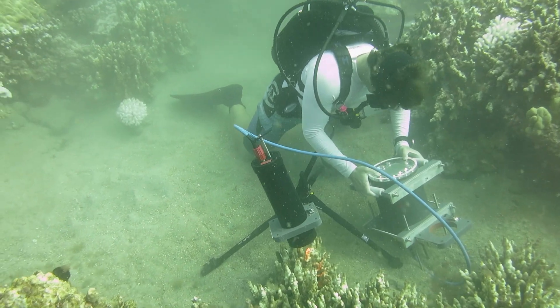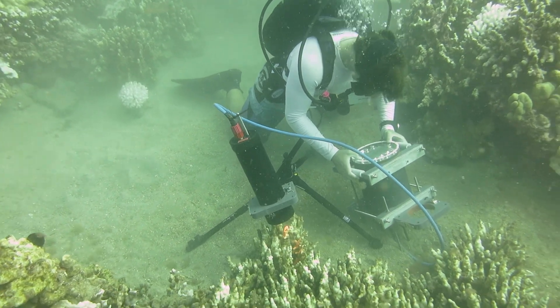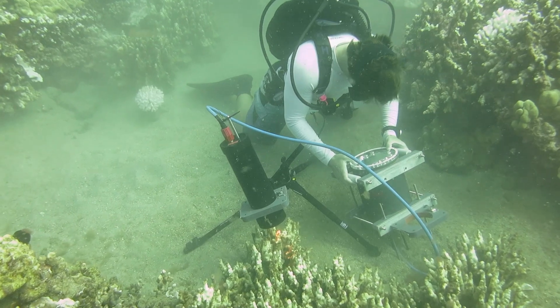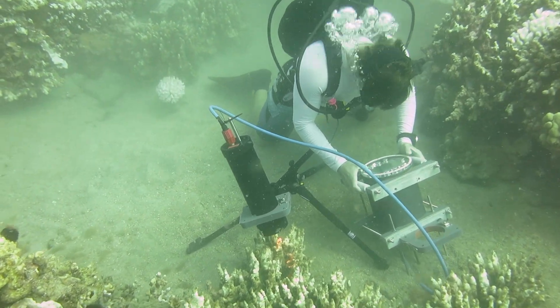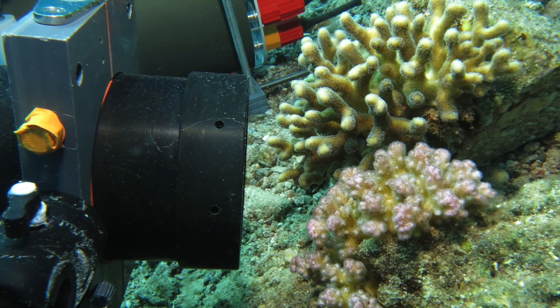When we set it up we first put it into rough placement using the tripod and then using the tunable lens inside we're able to precisely focus on what we want to look at.